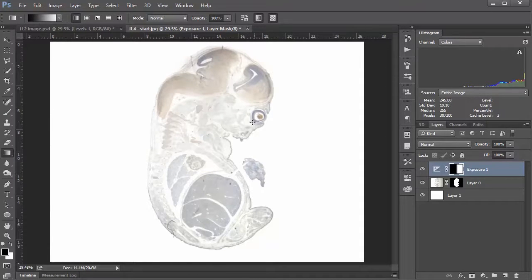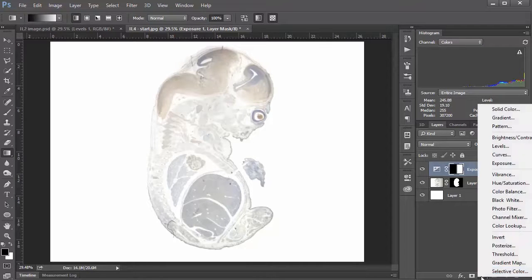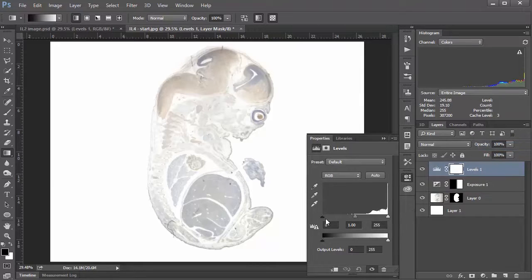But now we have the issue that the image itself is starting to look a little overexposed entirely altogether. So to correct that, I'm going to go down to my adjustment layers and create a levels adjustment layer. And all I'm going to do is take this black slider and drag it up to the edge here. I've covered the levels adjustment layer, I think, in one of my ethics videos, so you can have a look. But to do something like this is perfectly fine. Ultimately, all you're doing is just bringing this slider over to stretch this histogram out. And so you're not losing any image data that way, so that's perfectly ethical.